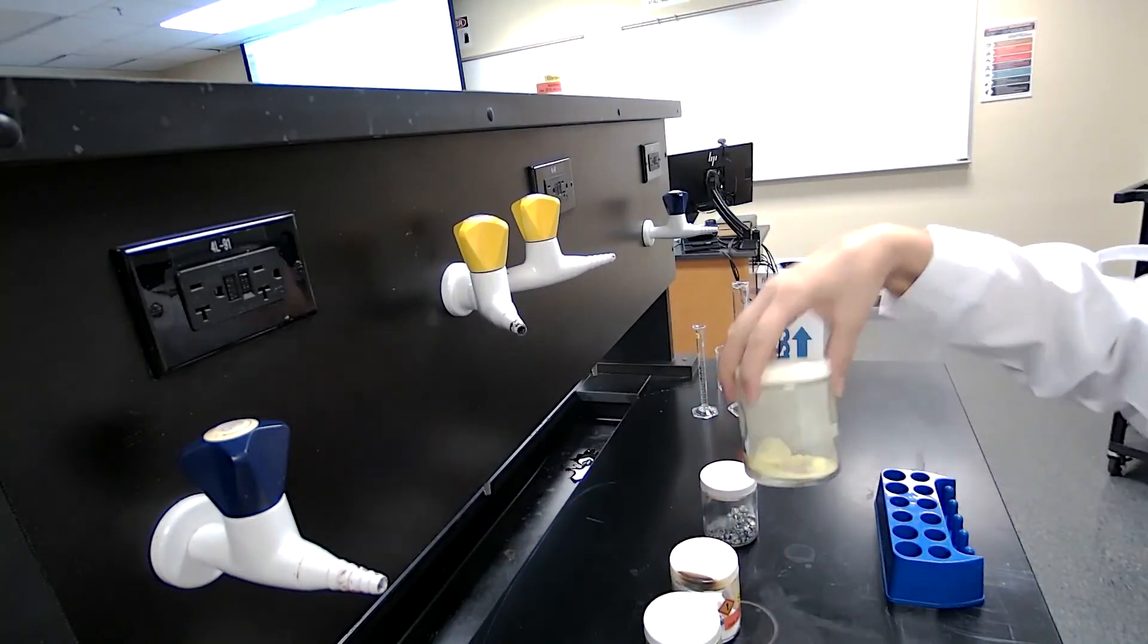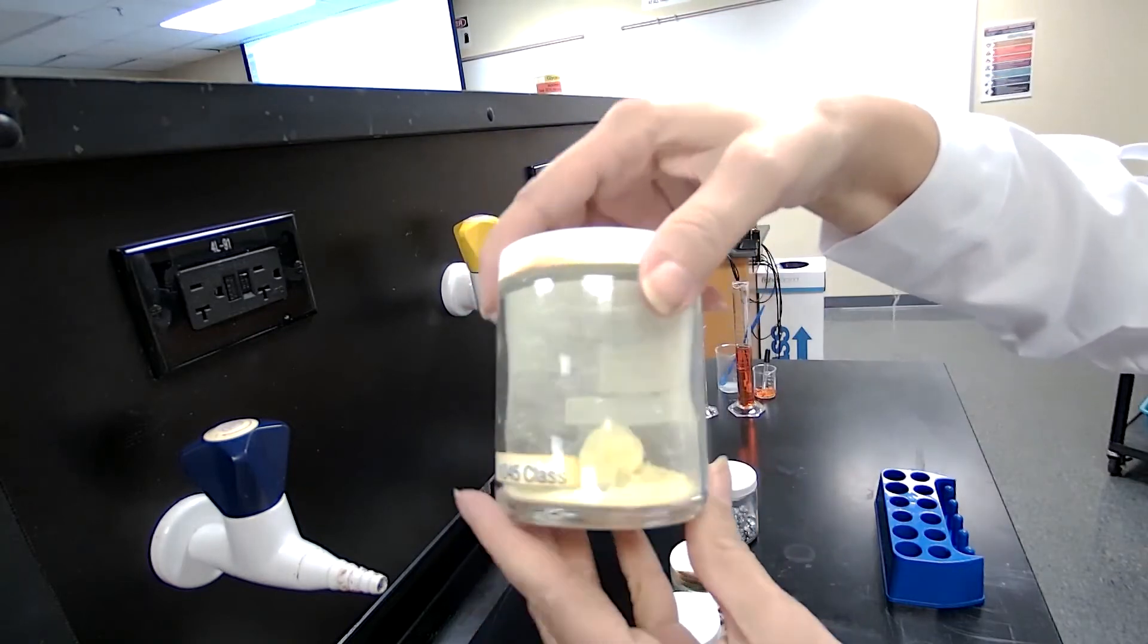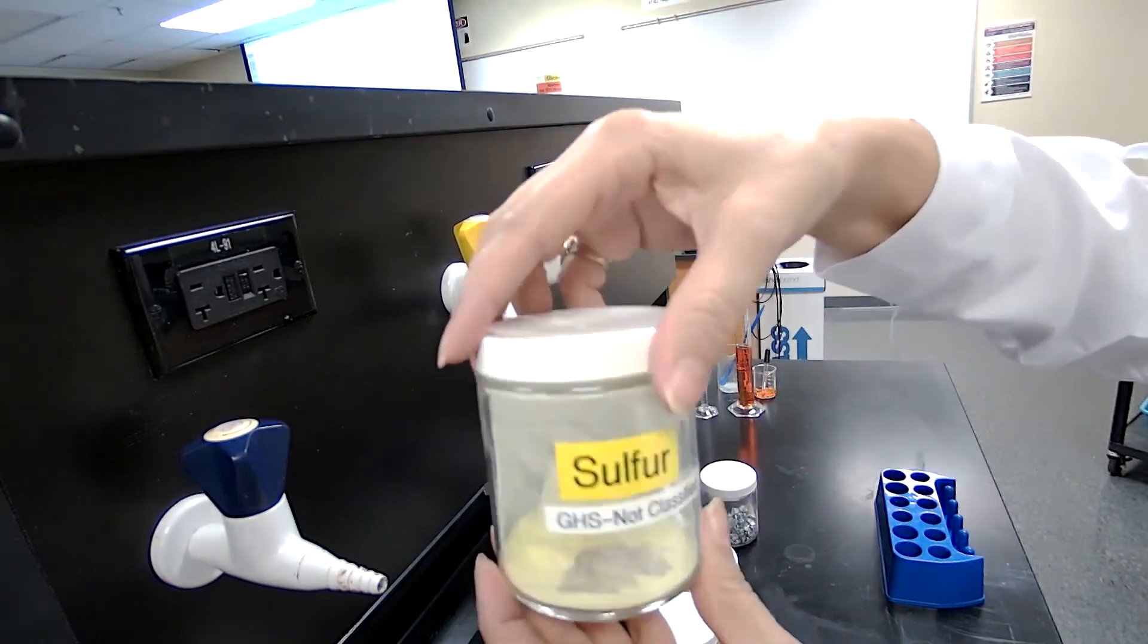Next we have sulfur. Record your observation for sulfur based on the physical property, based on the appearance, color, and how it looks.